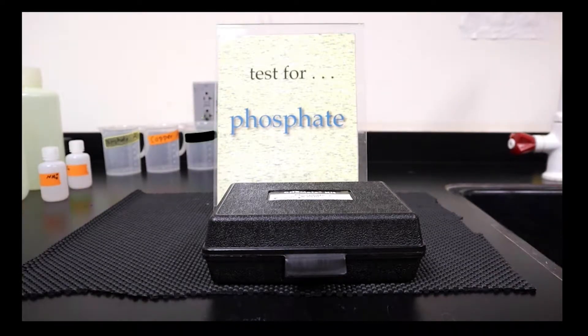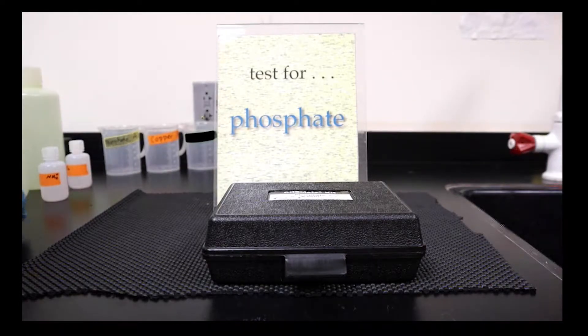Today we're going to do a little water chemistry. After a hard day in the field collecting samples, we brought back samples from well A and well B, so let's take a look at the concentration in these.